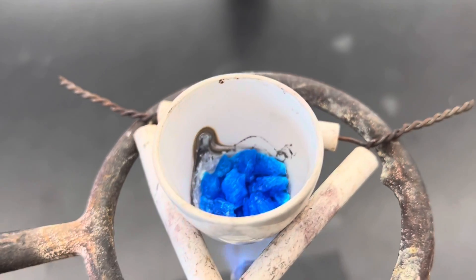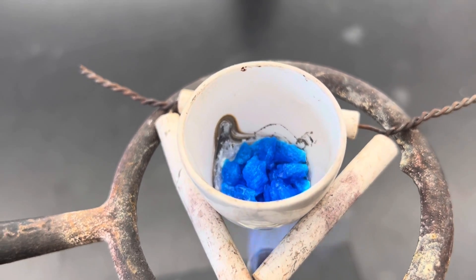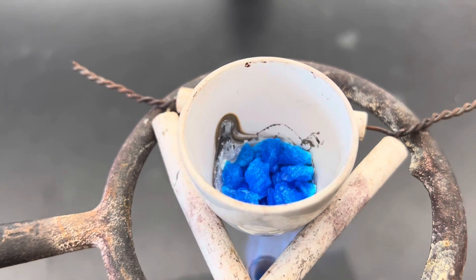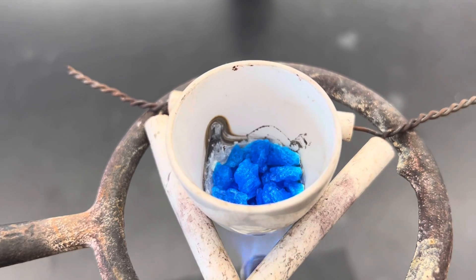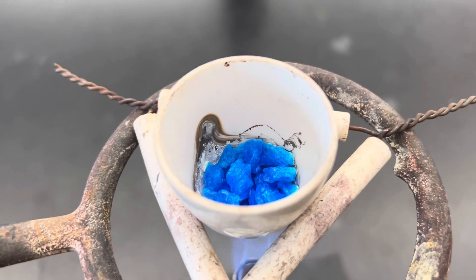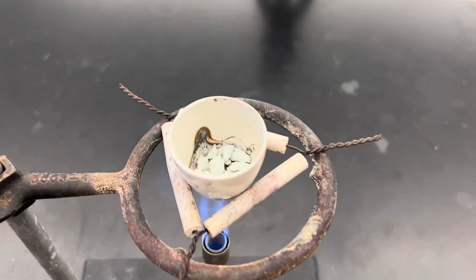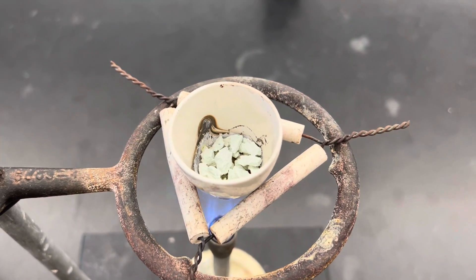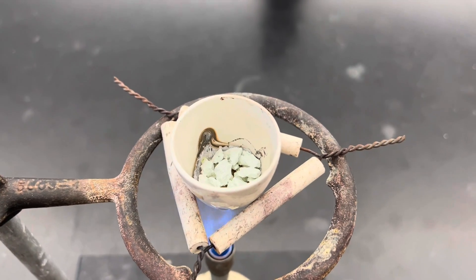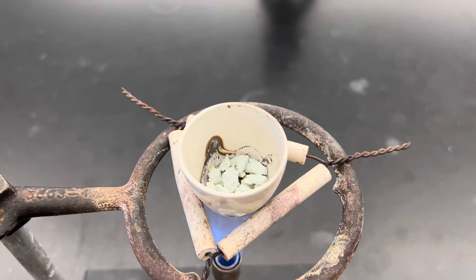I'm actually hearing a little bit of the water evaporating, sort of a sizzling boiling sound, and the crystals are starting to turn white, which means that the water is starting to evaporate out. Now we can see that the crystals are almost completely white. It's been on here for almost 20 minutes. I let it go a few extra minutes, and we'll turn off the heat now.